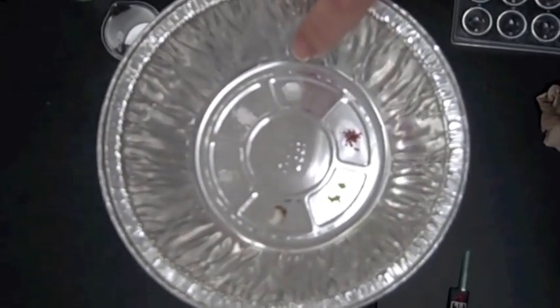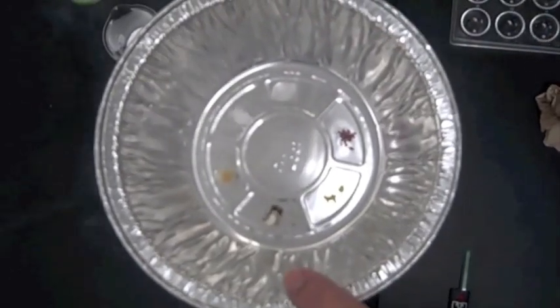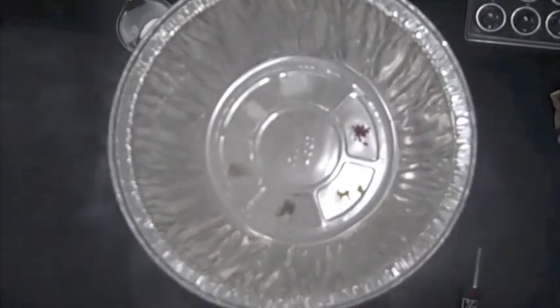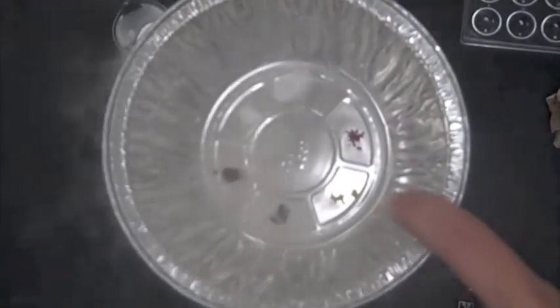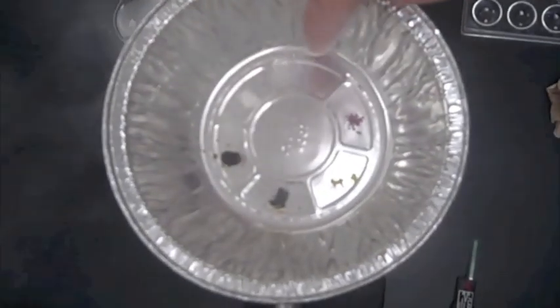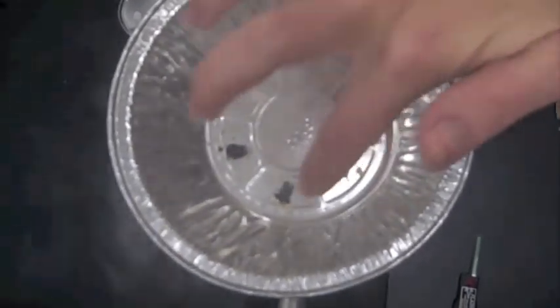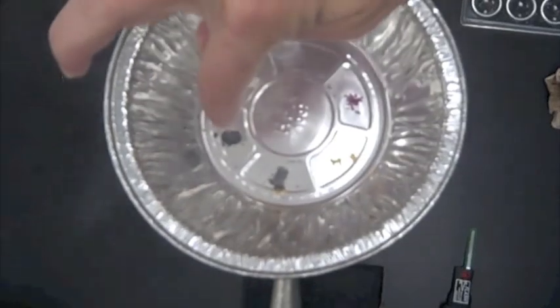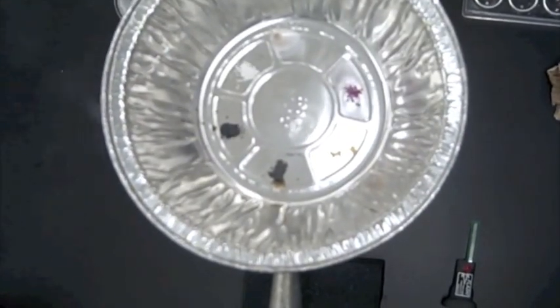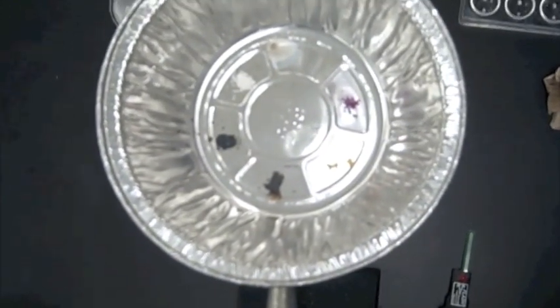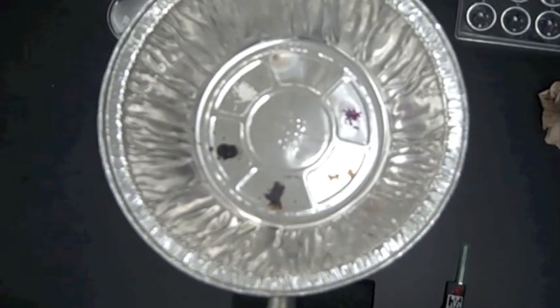Okay, right here we got five has gone, two has gone, one has gone. One, three, oh wait, that's one, two, three. So three went first. Four, five, six went second. One went third. And the other three are just there.